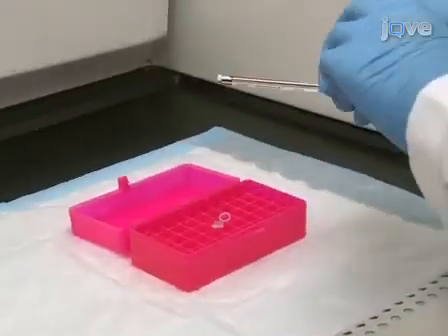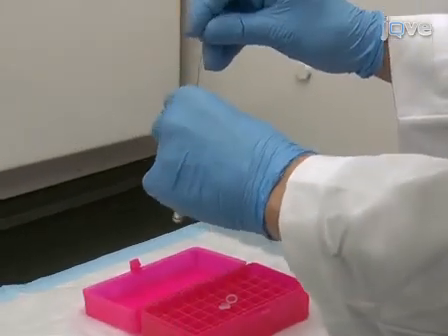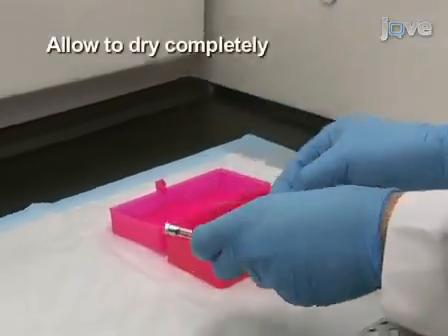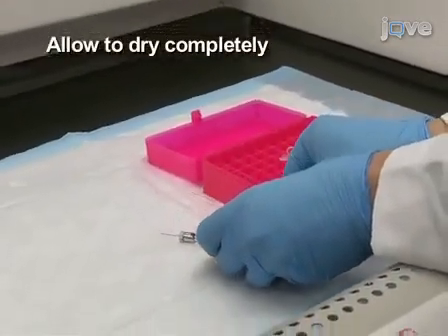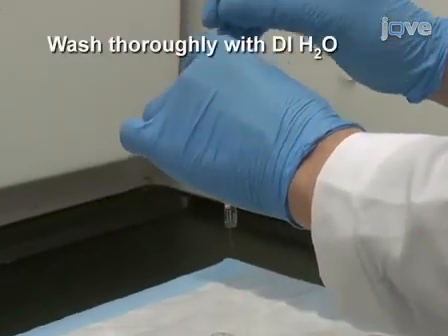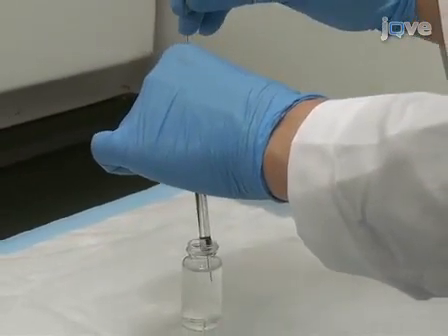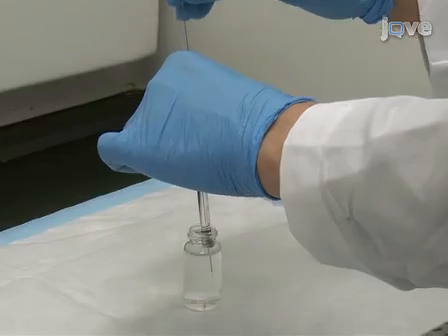Then empty the solution from the syringe, remove the plunger, and allow the syringe and needle to completely dry. Finally, wash the syringe and needle thoroughly with deionized water. Once silanized, a syringe and needle can be used for more than 6 months before a recoating is necessary.